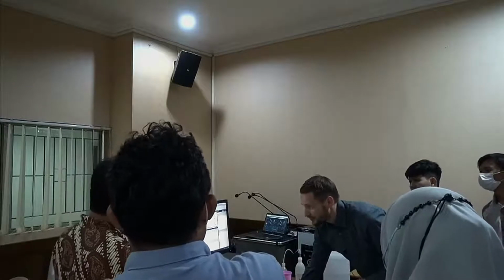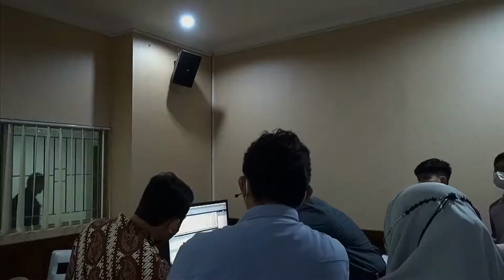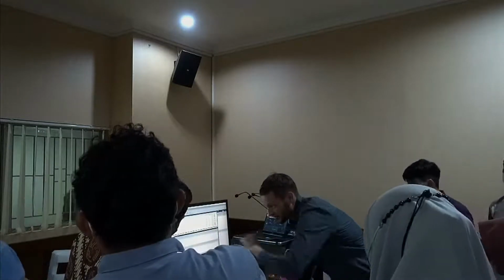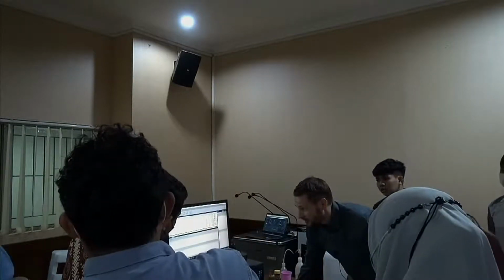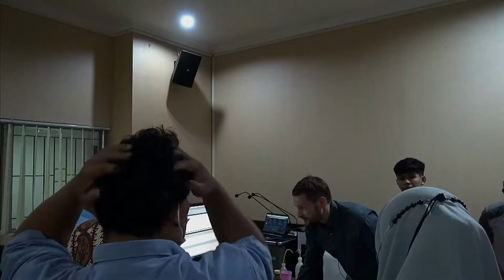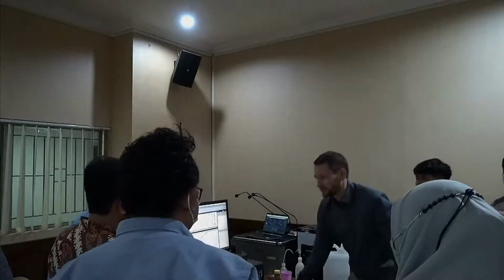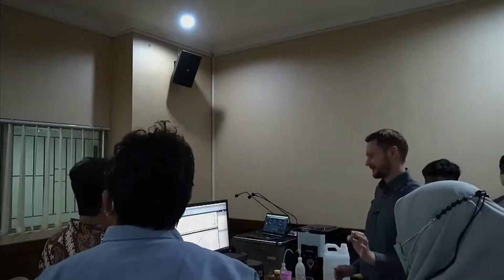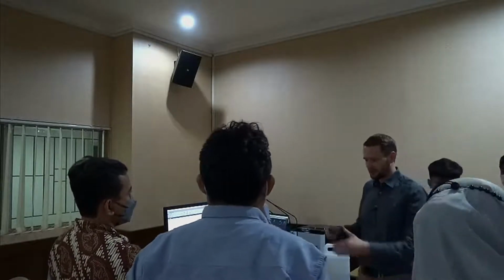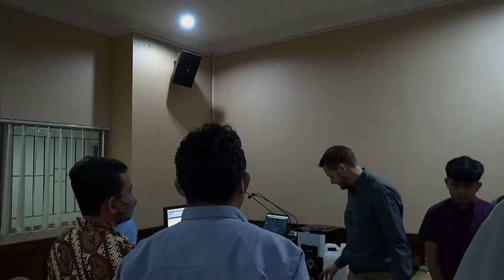If you look at the numbers, you see first measurement D50 34.0, then actually it gets a little bit bigger, but the third one it gets much smaller here at 32.5. So you see it's not as reproducible as, especially compared to the first three sets of measurements, which were really, really nice. So here it's not that nice anymore.